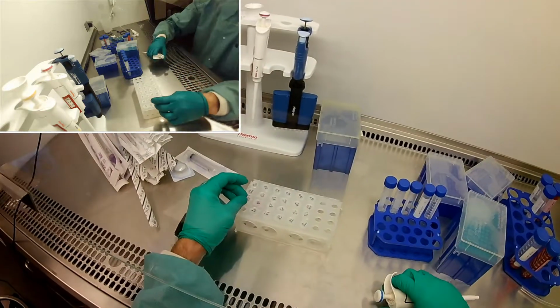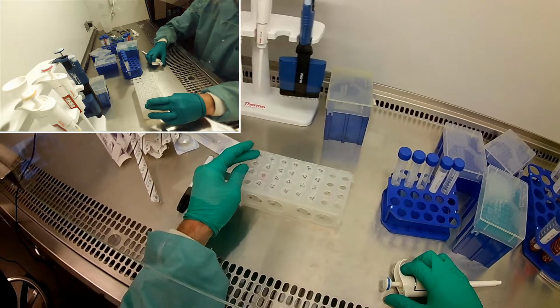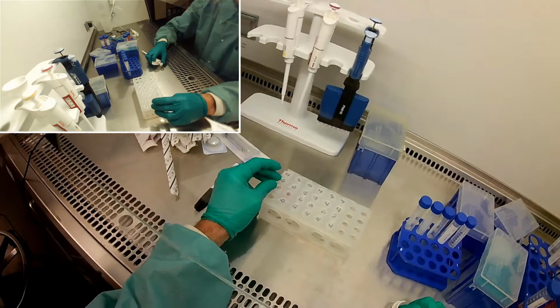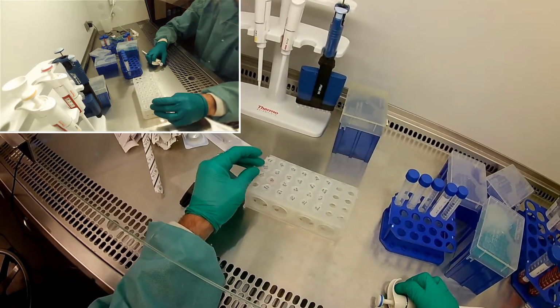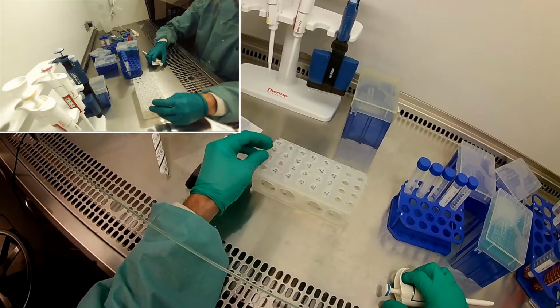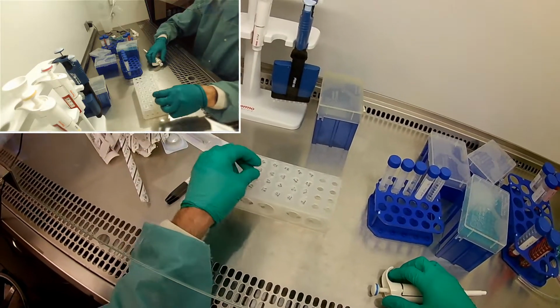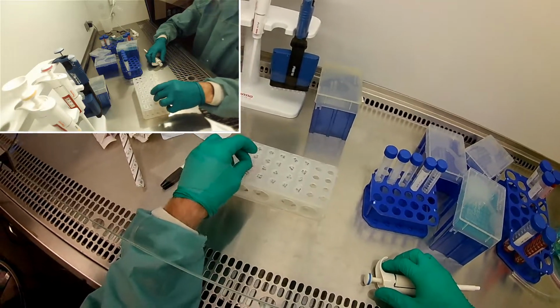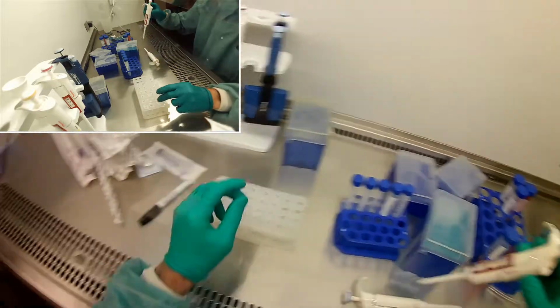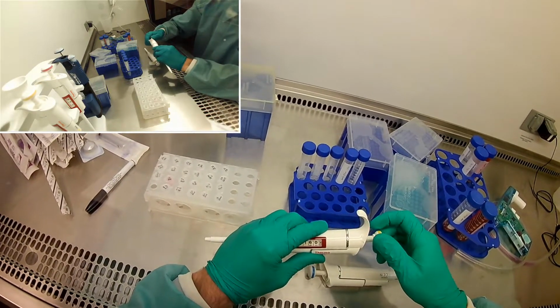The 100% bleach, 100% ethanol, and 100% antibiotics definitely sterile. These things I got from outside the hood, but if anything's growing in there, then coronavirus is the least of our worries. We got to worry about whatever can survive that. So I'm pretty sure nothing is living in there. So now we just need to add 160 microliters of ethanol.